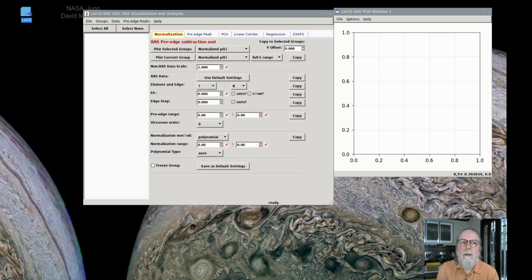Real experimental XAFS data can be messy and have systematic differences from ideal XAFS spectra, or at least have differences from other spectra that you might want to analyze. Correcting these differences makes it easier and more robust to analyze and compare multiple XAFS spectra.